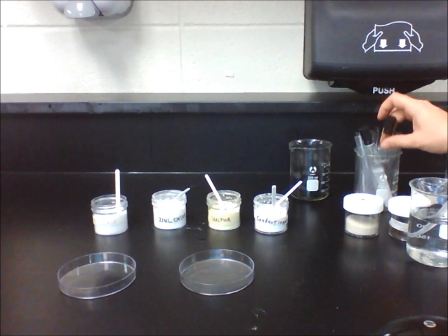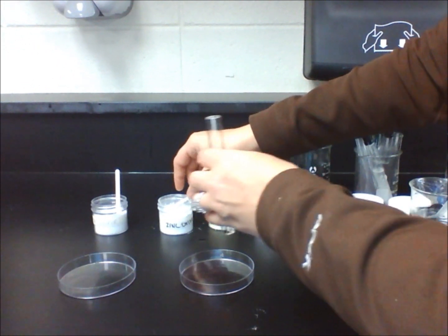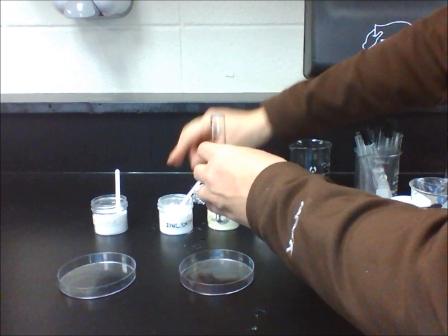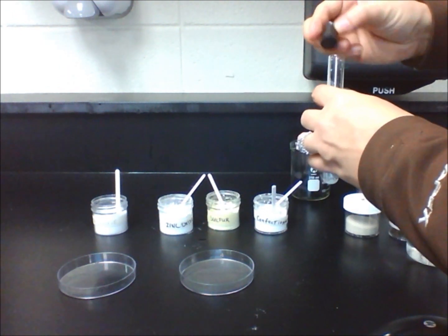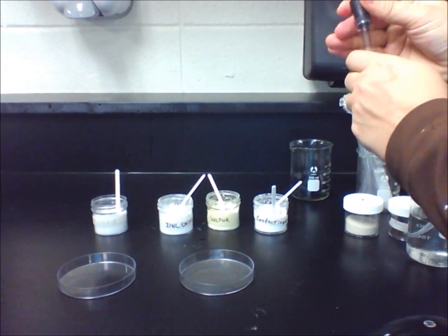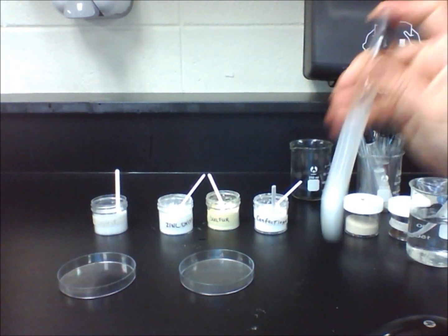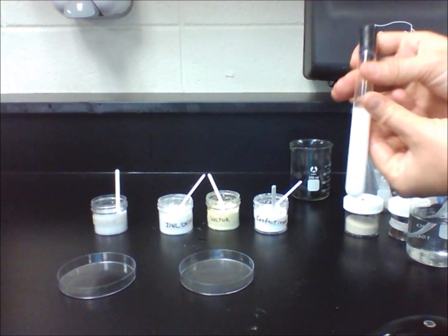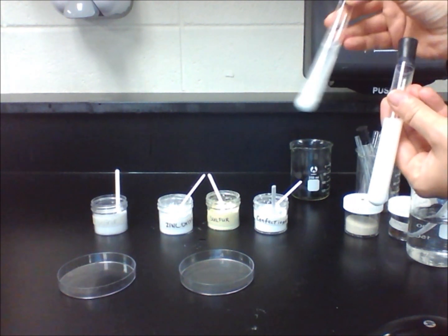Now let's repeat the procedure with zinc oxide. After shaking the mixture, you will notice that the water is no longer clear — it appears milky and opaque. Because it looks like the color of the water changed to white, you might say that the substance did dissolve. However, after a minute or two, you will notice that the water becomes a little clear again and the zinc oxide settles to the bottom. Therefore, it does not dissolve in water.